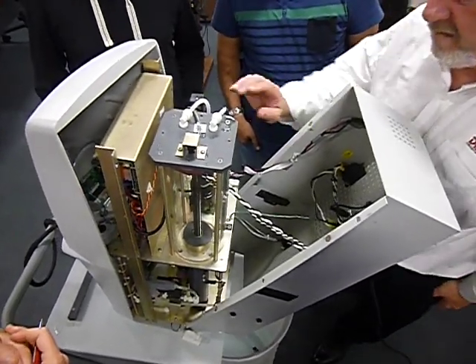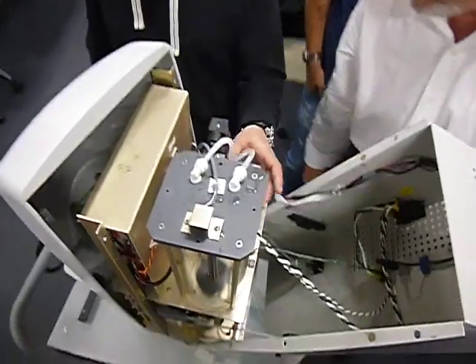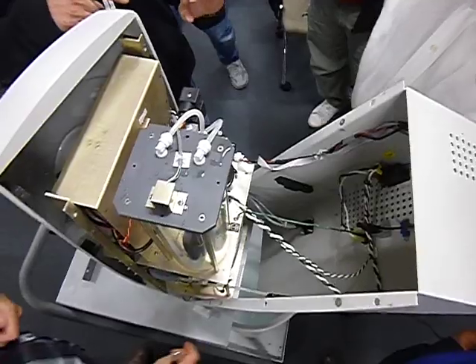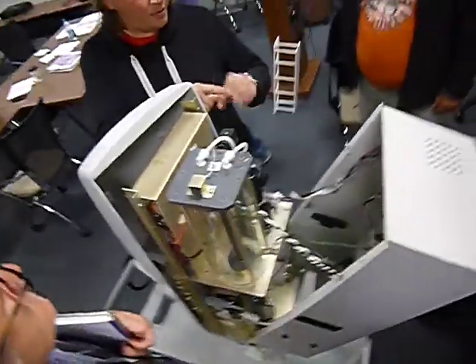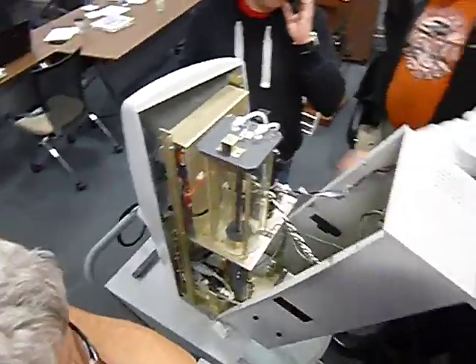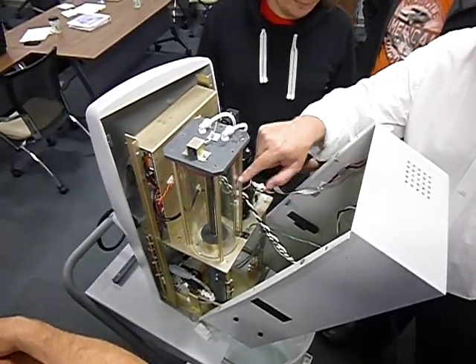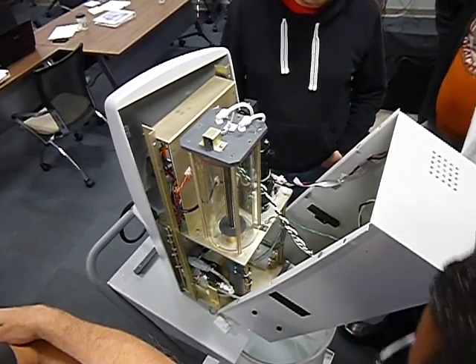I've never seen a motor go bad. He probably has. Not the motor, but the gear inside. There is some tooth wheel and it's pinned through, and this pin was snapped off, probably because of all the pressure. It might have been this corkscrew, what they call the corkscrew or the lead screw, underneath there.